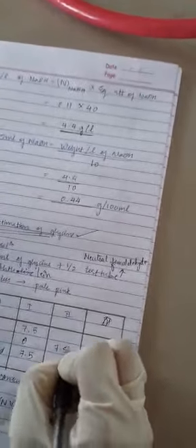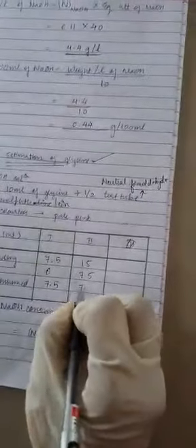So it is almost on 7.5. Now go with your calculation. Yes, it was initially 0 and it is 7.5. So the total volume consumed is 7.5.